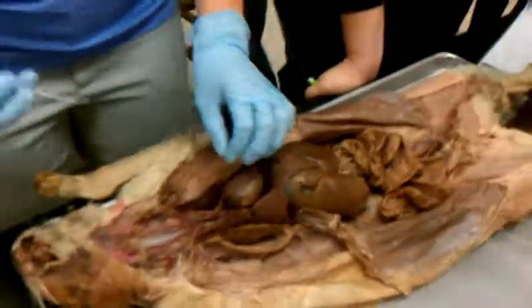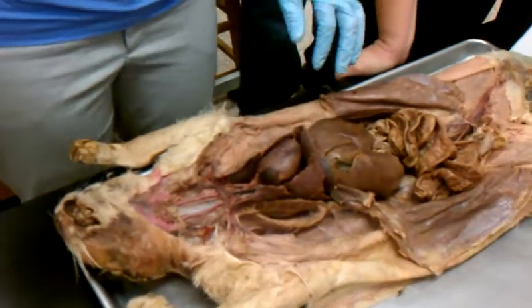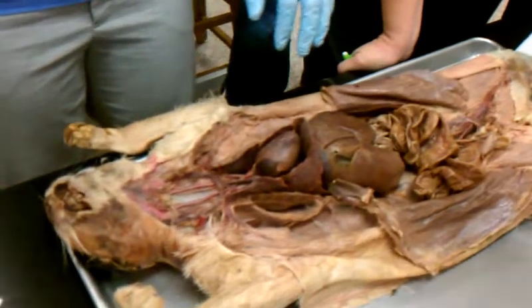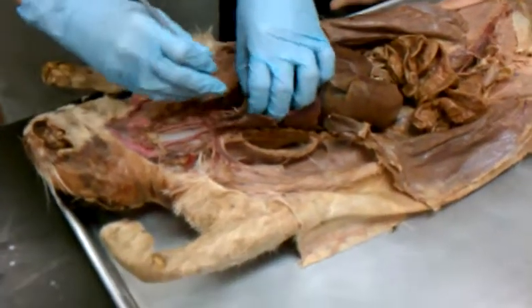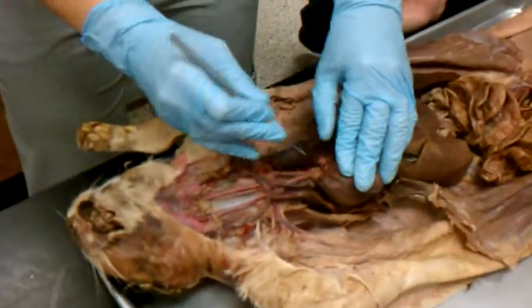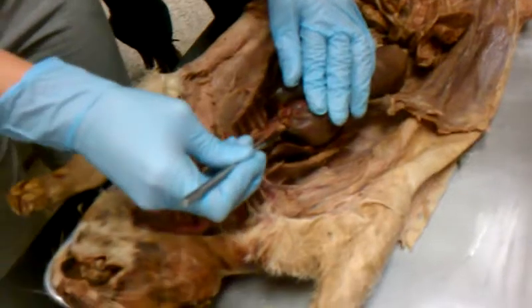That's fine. Alright. So on top of your heart, remember on the model here you have the one that went around the heart? What was that called? Aortic. The aortic arch. And that's the aorta. So on the heart you have an aorta. It goes around the heart. If I were to pull this part of the lung back, this is the aorta. Do you see how it kind of curves?